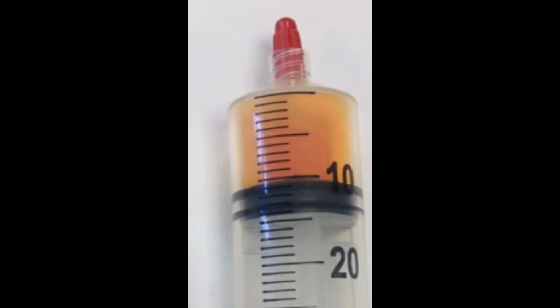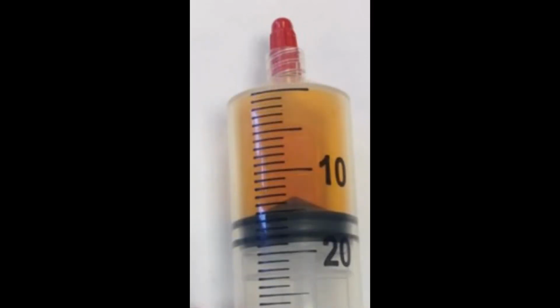This is because pressure favours an equilibrium position with one molecule of dinitrogen tetroxide rather than the two of nitrogen dioxide. When you pull the plunger out again, the reverse happens. The colour goes paler and then, again, returns to normal.